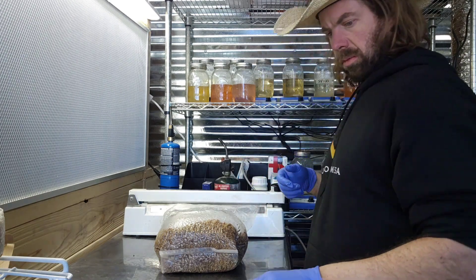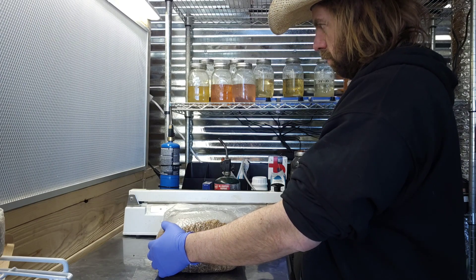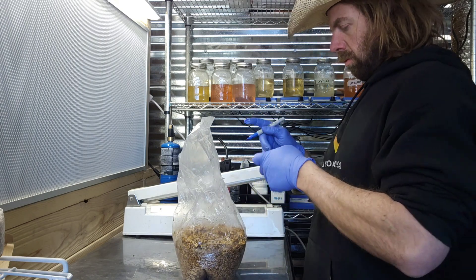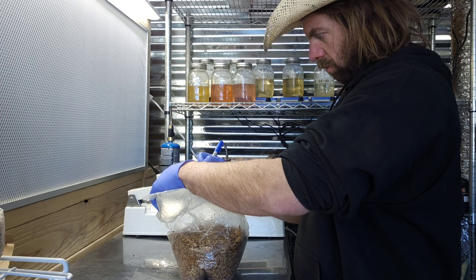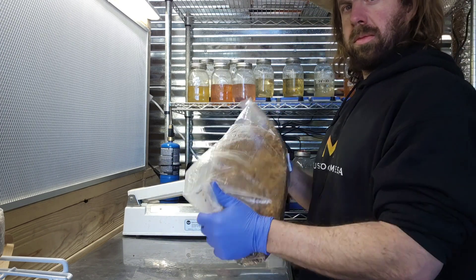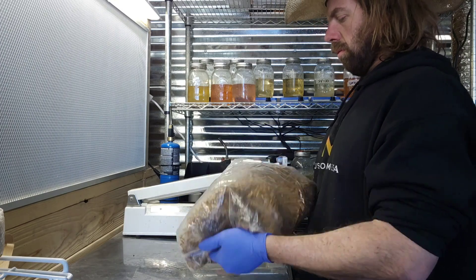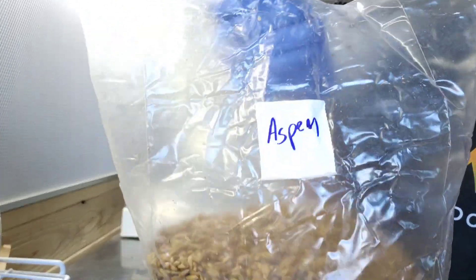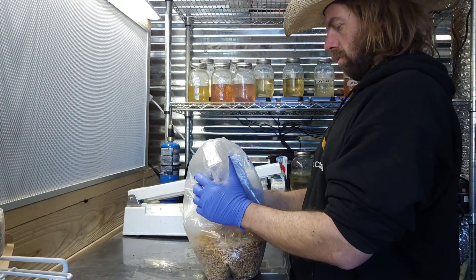I really like opening those gussets up — that's a good tip. I really enjoy the magnetic sealer and I'm going to do specific videos just on the sealers. I've got some older cheaper ones that worked absolutely great too. Also as far as markers — if you have wet spawn bags with water residue, you can get a wet marker and that can help. When writing on the filters, be careful not to punch through them — they're pretty delicate and you can break right through.